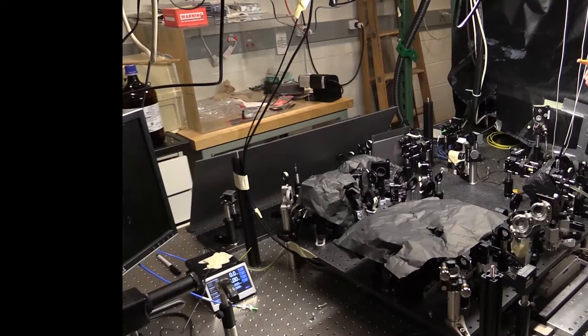Also, whenever you're aligning a confocal microscope, it's very important to be safe and to have the correct safety goggles.